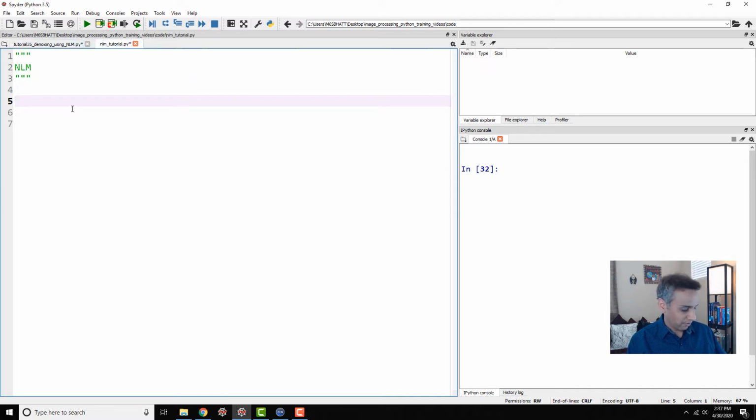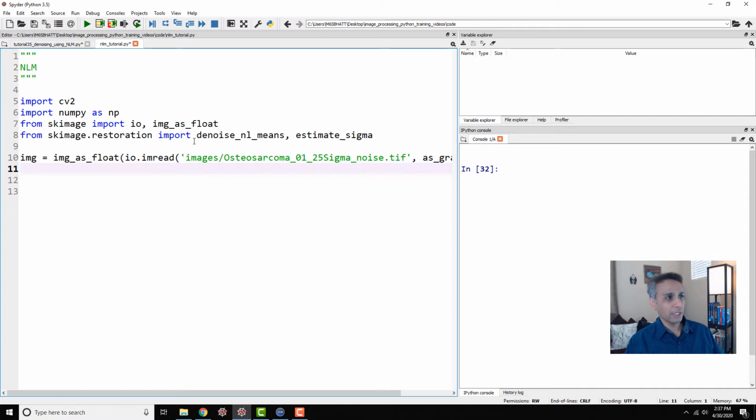So first of all, I'm going to import the required libraries, and non-local means filter is available as part of scikit-image.restoration. Again, please go ahead and Google search for scikit-image and non-local means, and you'll find the documentation and you can see what else it can do. Within scikit-image and restoration, probably because they use this for image restoration by denoising, it's available as part of that module. So I'm going to import denoise_nl_means. I'm also going to import something called estimate_sigma from the same module.